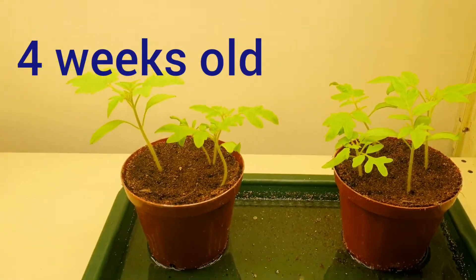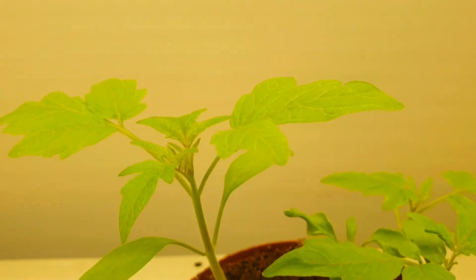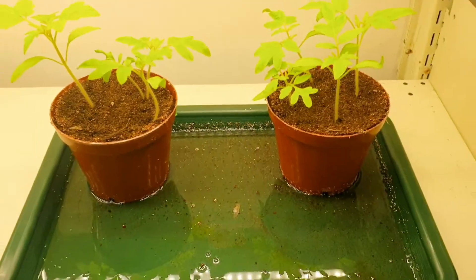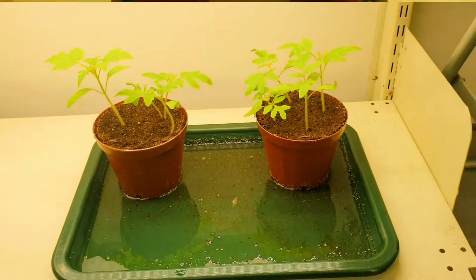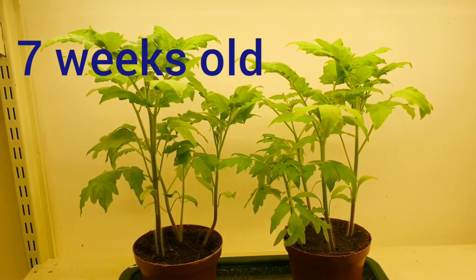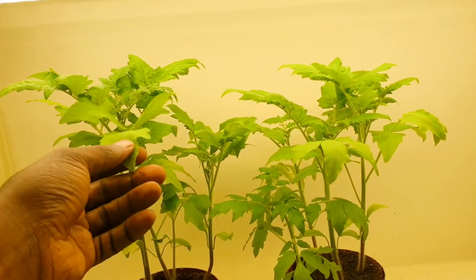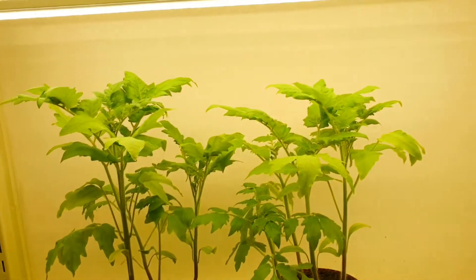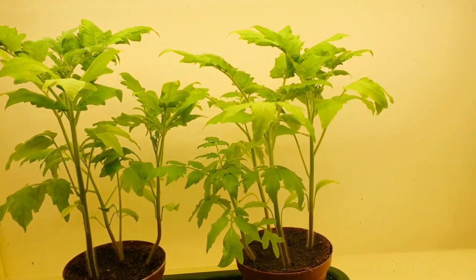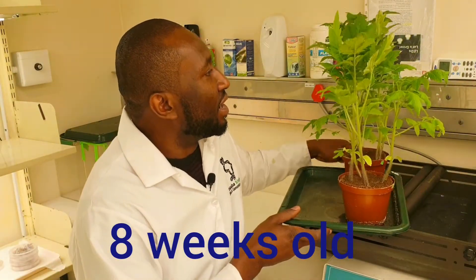Now the seedlings are four weeks old. You can see they are looking good — no contamination. They are looking so well. This is a seven-week-old Money Maker tomato. As you can see the tomatoes are hairy, growing very well, getting enough nutrients and enough light. And the tomato you are seeing here is eight weeks old, looking good, still so hairy and fine.